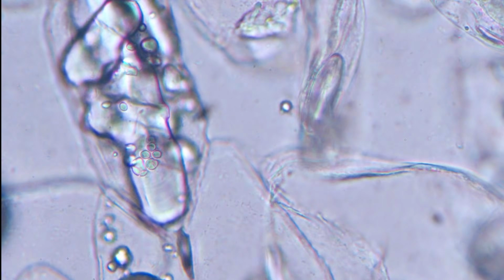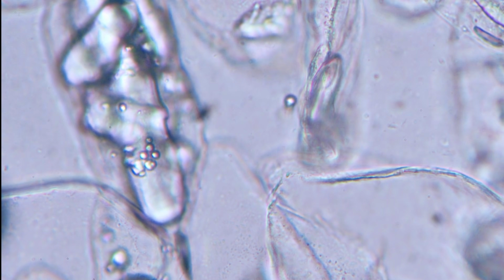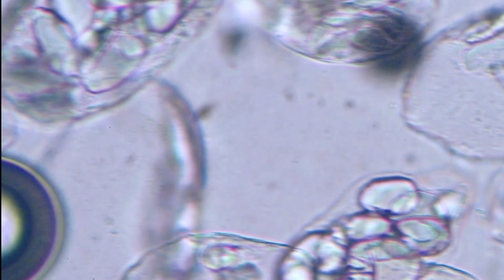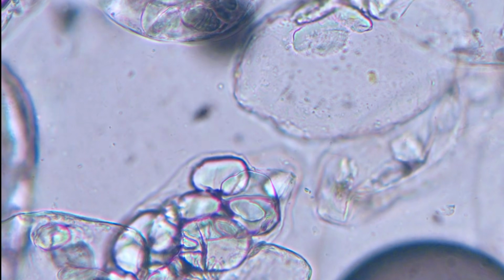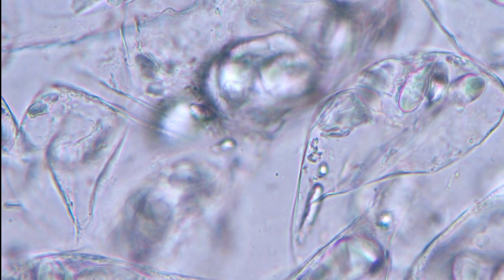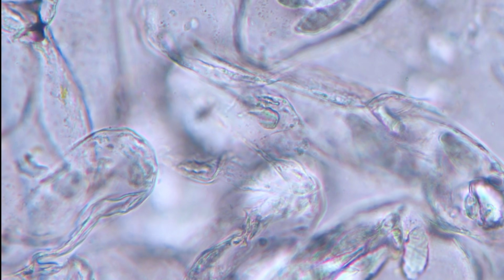Let's focus and see. So what you can see, those are granules that you find in anything that contains starch. And also you can see some air bubbles which are trapped in there because you have water. So this is a normal banana. You're going to expect this in a normal banana. I'm sure you've not seen anything moving. Maybe we might see in those which are rotten, but let's see.